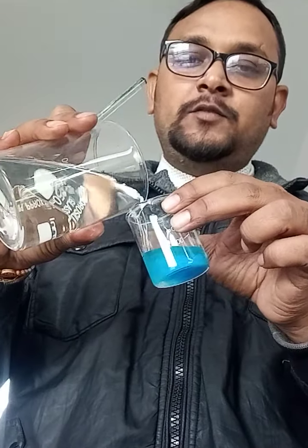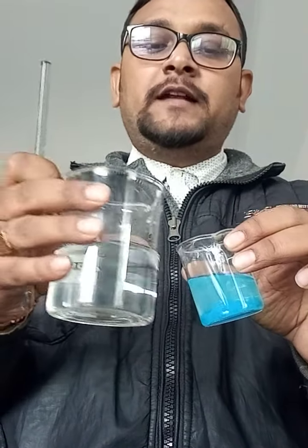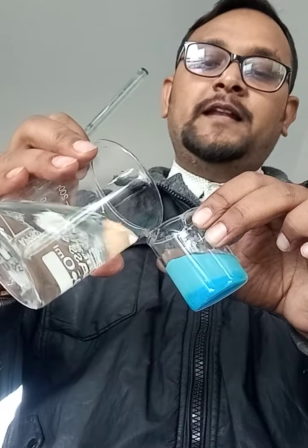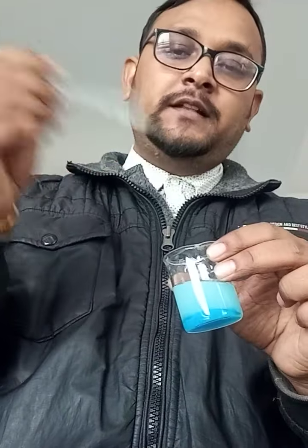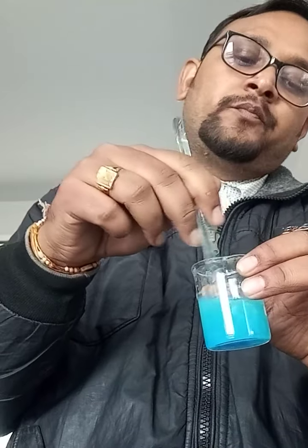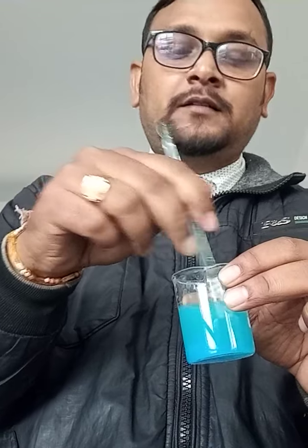See, here I have added water. You can see how I have tilted it. The direction is not toward my face; rather, at a 45-degree angle I am pouring it by the side of the beaker. These things you need to follow for the test tube as well, but since I am making a video and want to show you on a larger scale, I am using this beaker. Then again with the help of the stirrer I am going to stir it and prepare this solution.